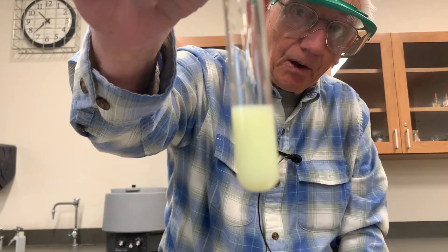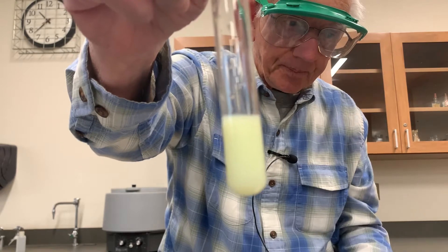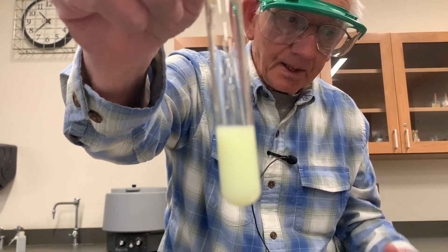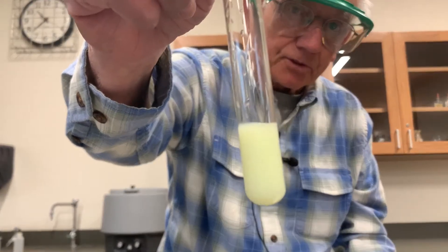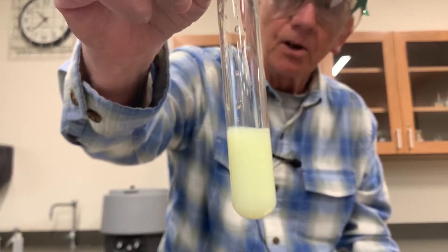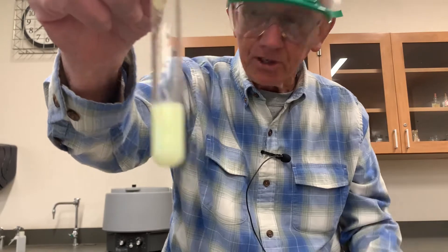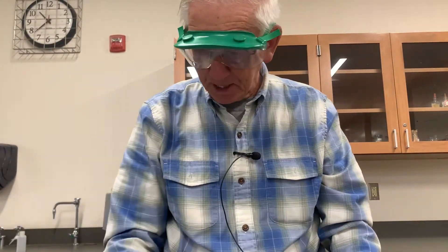Obviously a precipitate formed. And since all we have in there are barium ions, nitrate ions, potassium ions, and chromate ions, you know that the only possible combination for that precipitate will be barium with chromate, because potassium and nitrate never form precipitates. Okay, there's the chromate test.